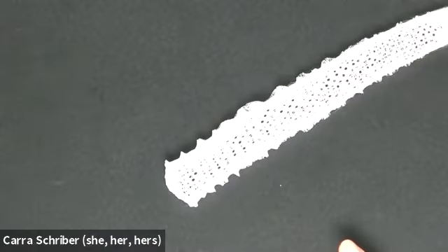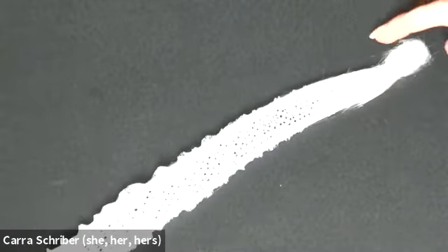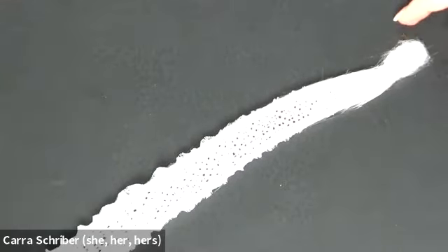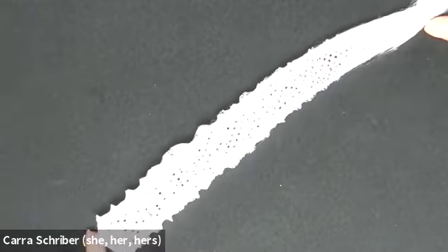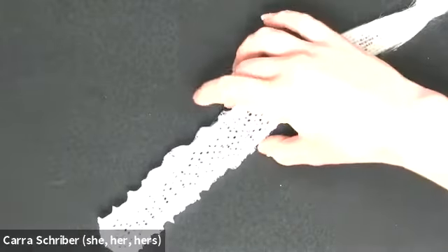And this glass sponge is really, really delicate. Let me just show you this piece. It feels like fiberglass down here, okay? That's because this shell that's left over from the sponge itself is made out of silica, right? The same thing that glass is made out of. That's why we're calling these glass sponges. All right, so those are our three classes of sponges.